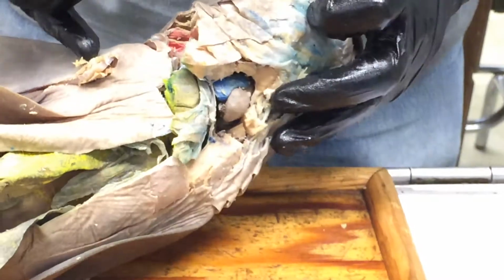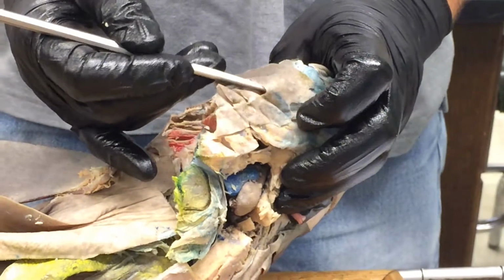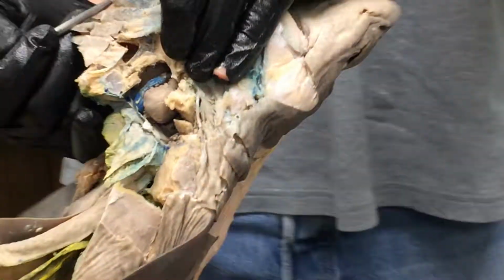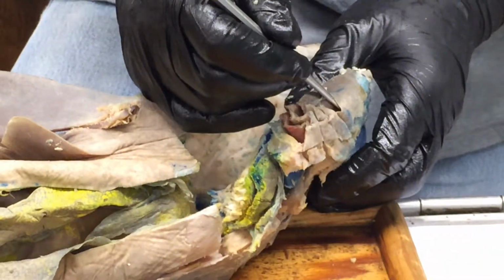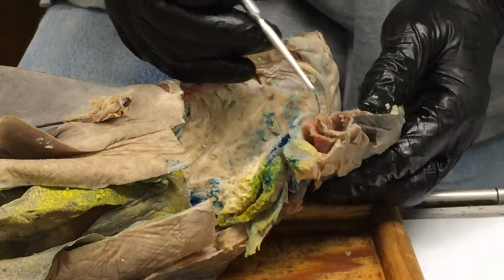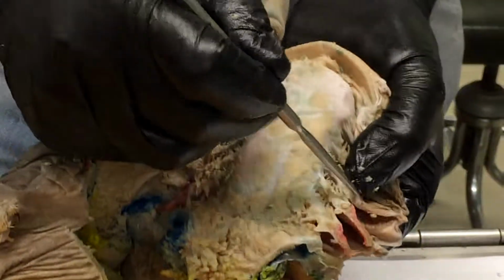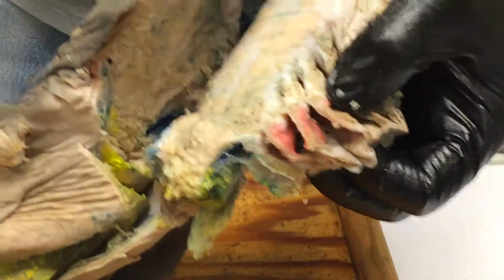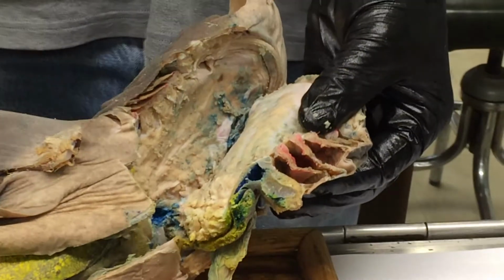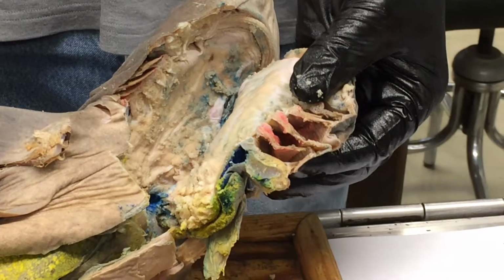Flap valve just refers to the little flap that covers over the external gill slit. That's the flap valve. Okay. Because it can open and close. The primary and secondary gill lamellae, basically when you look at the gills here, you see all these folds. Would those be the primary or secondary gill lamellae? These are the primary gill lamellae. The secondary gill lamellae are microscopic structures that run at right angles to those folds and are additional folds to additionally increase the surface area. So we're not seeing those.